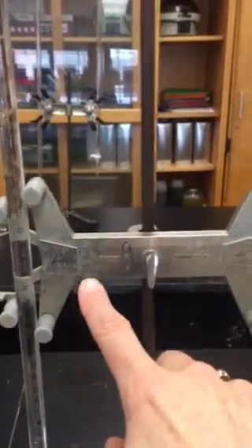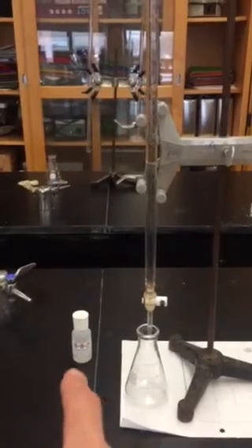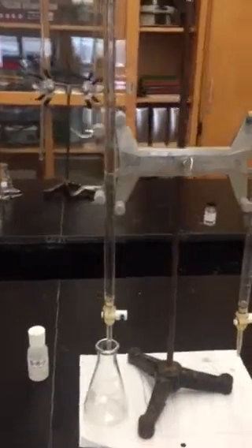When we look at the burette clamp, you're going to see A and B, so as not to forget: acids on the left and bases on the right. You're going to have some phenolphthalein over here in a container, an Erlenmeyer flask, and a piece of white paper so that you can see color change more easily.